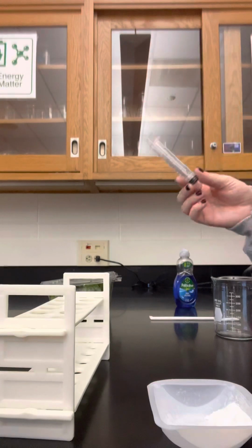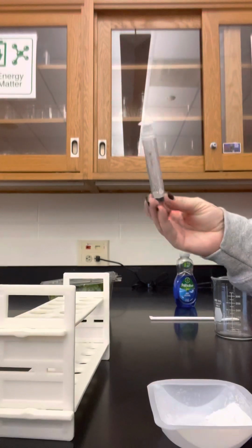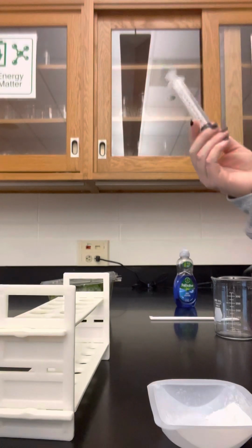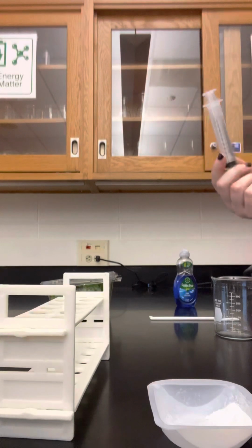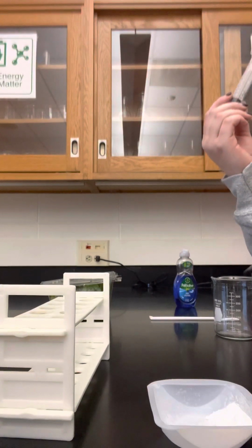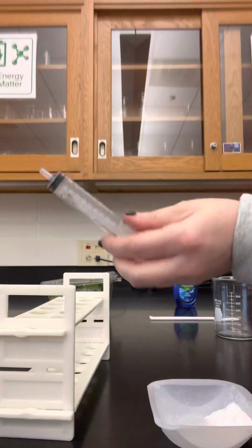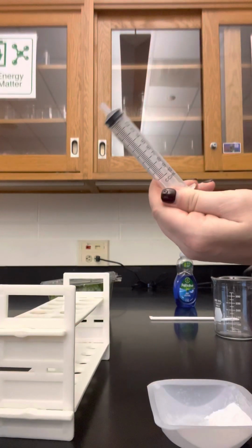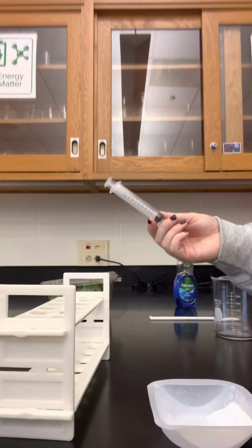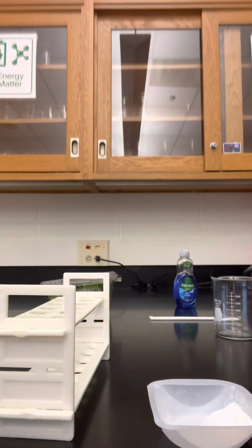For your experimental syringe, you need to figure out how you are going to subject this to a different type of light. You can use natural light from the windows. You can use the flashlight on your cell phones. You can use an actual flashlight, but you need to somehow subject one syringe to the normal light and another to some other experimental light. And you need to write out a procedure for how you are going to set up your unique experiment to test the variable you've been assigned.